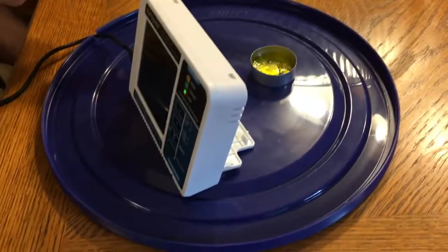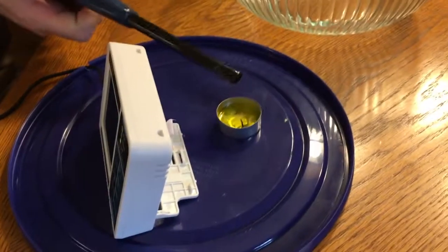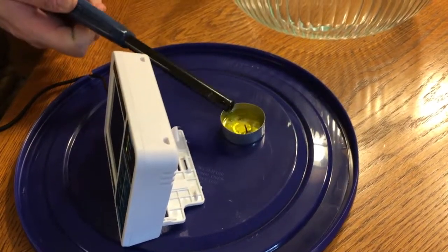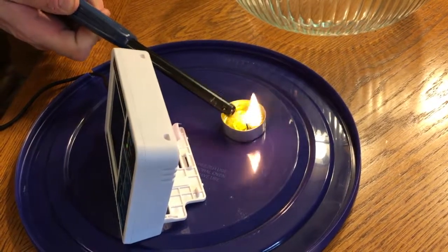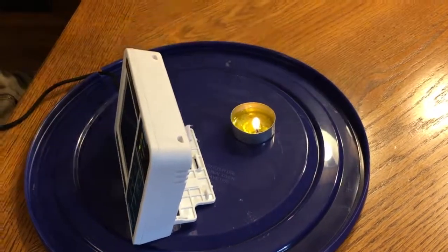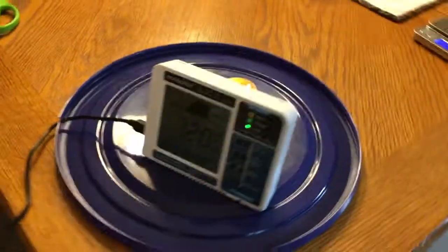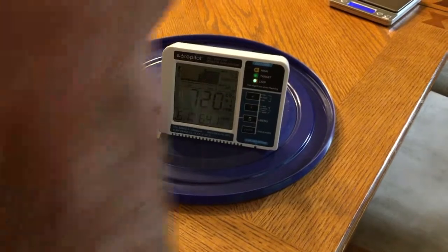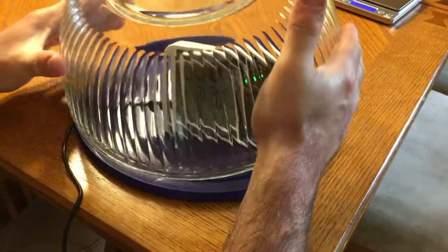I'm going to start this on fire. If you watch over here on the detector, we're still at about low 700s for CO2, relative humidity is about 60%, and then if we close it up.